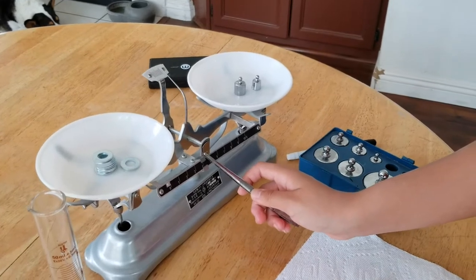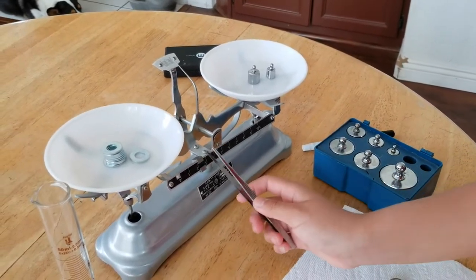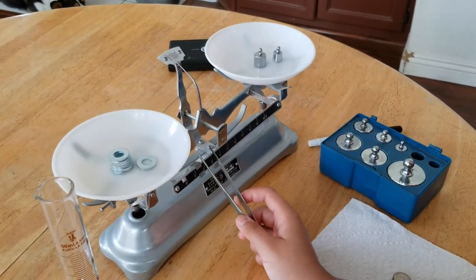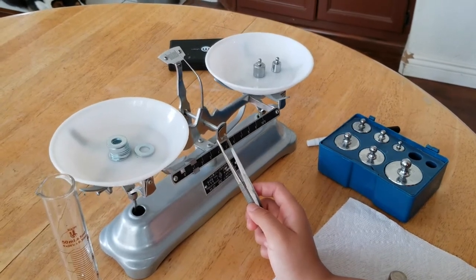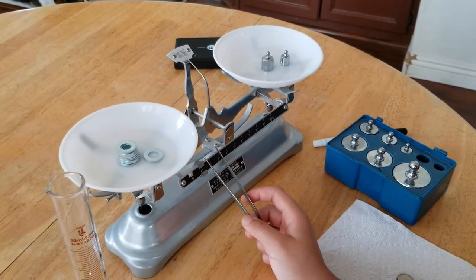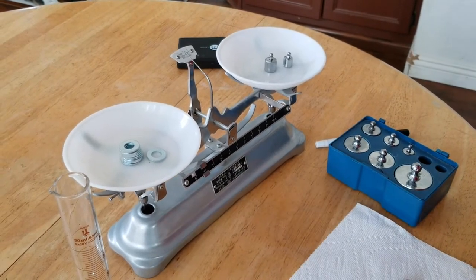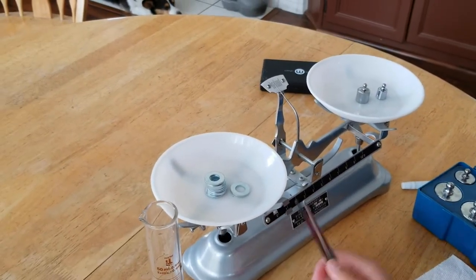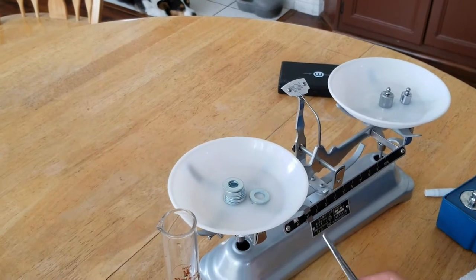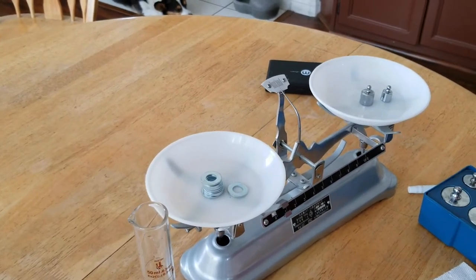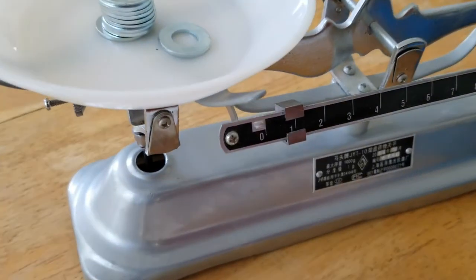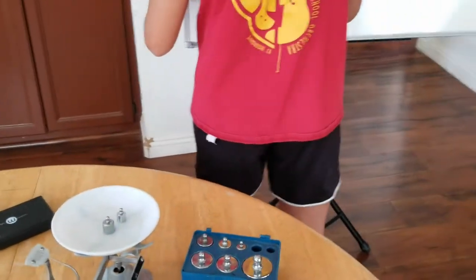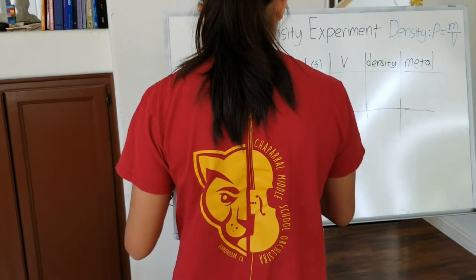Yes, that seems to have done the trick. So let's move this back. Okay, so this line is about aligned with the red one. So if you check here, that's about 30.6 grams. You can see that. You're looking at the line at the end. So, 30.6 grams.